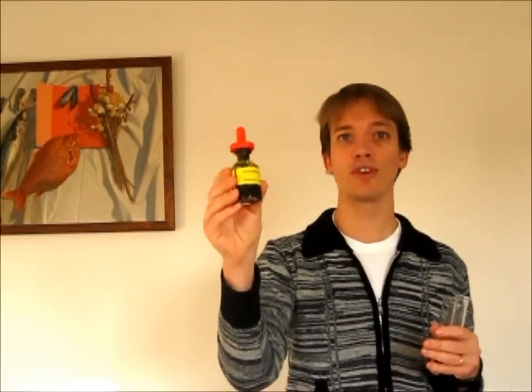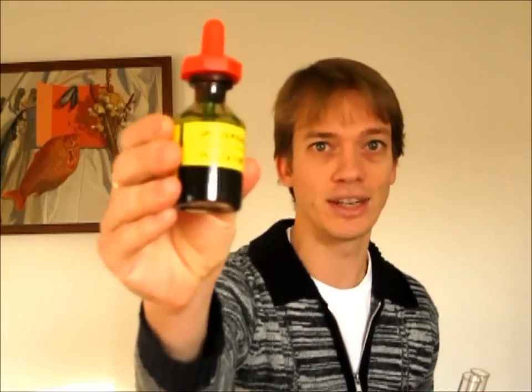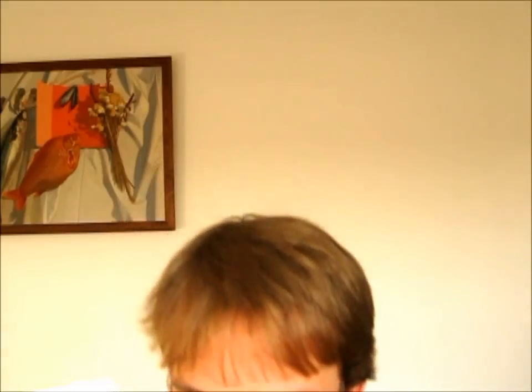This is the indicator I'm going to use. It's called universal indicator solution. I'm going to add it to first water and then hydrochloric acid. Let's see what happens.